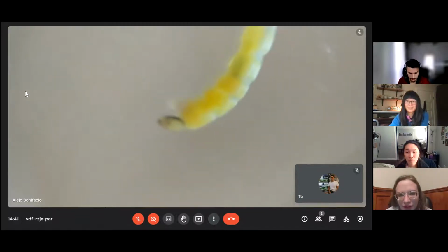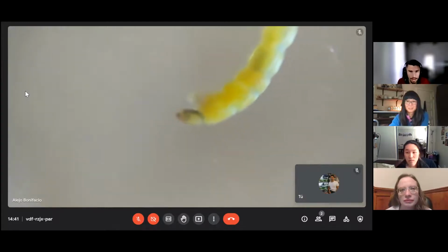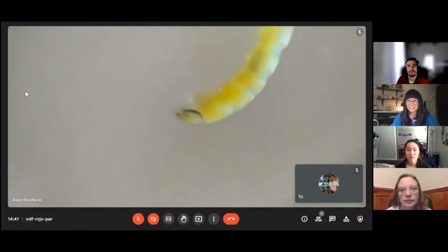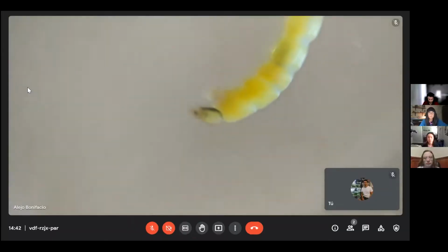And we have the face, the head, I'm sorry. You can see there is a tiny eye. I have to get a more precise focus, but you can see that is the head, and they have only a pair of arms. That is different from the mayfly. The mayfly has six legs, you know. This is because they are very different kinds of immature insects.